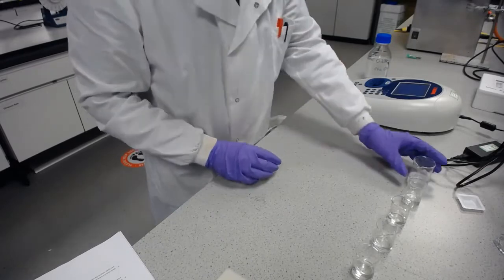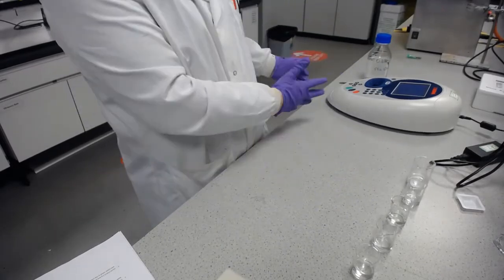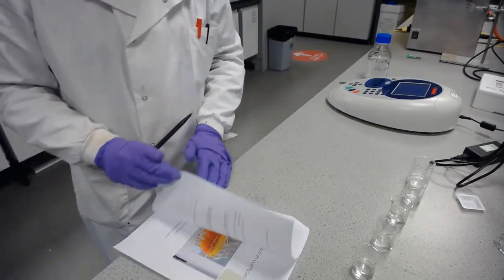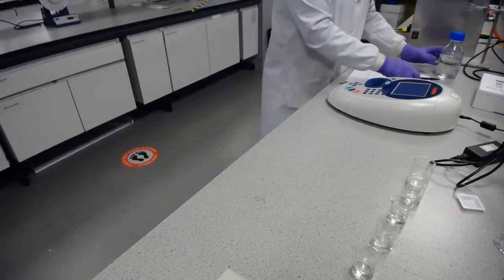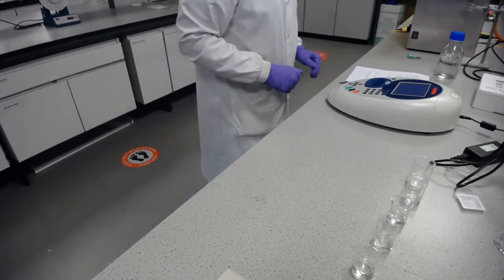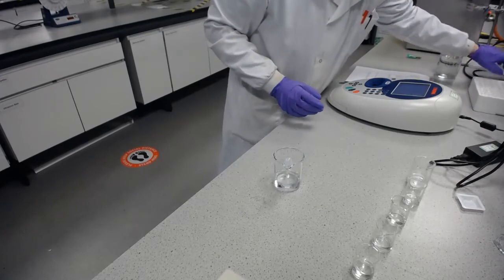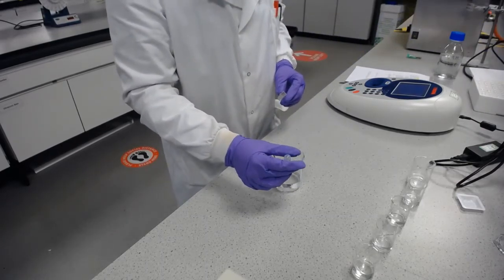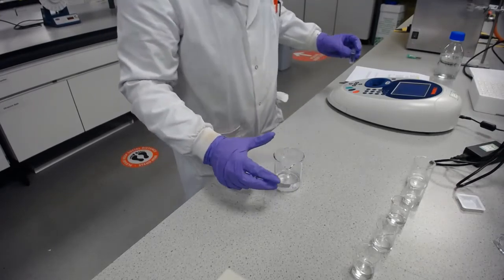And there we have it. We have 5 serial diluted concentrations with which we can take our measurements to make a calibration curve. And so all that remains to do in the lab is to blank the spectrophotometer to our sodium hydroxide. So we tell the machine to ignore essentially the absorbance of the cuvette and the solvent. That's what we're doing when we blank.